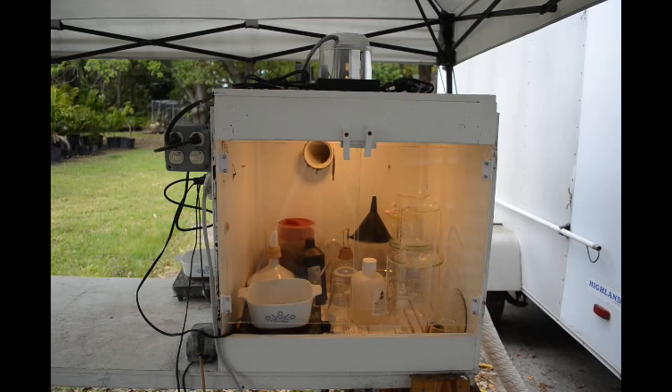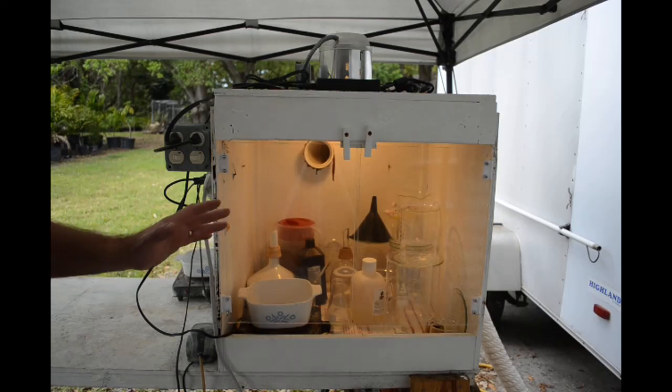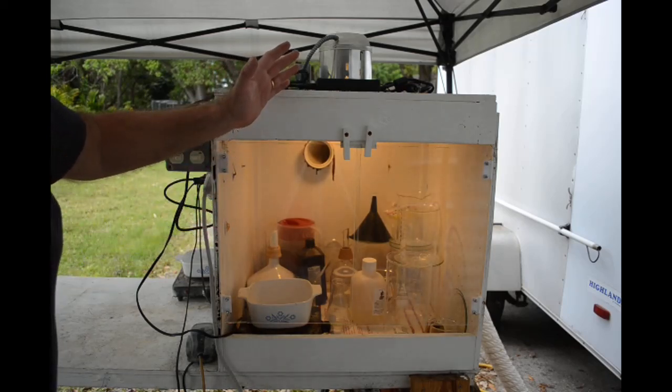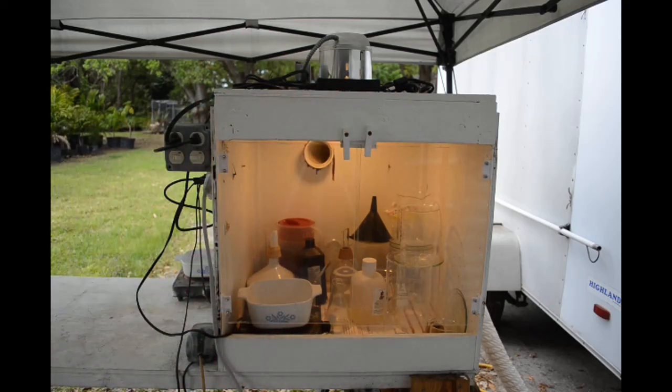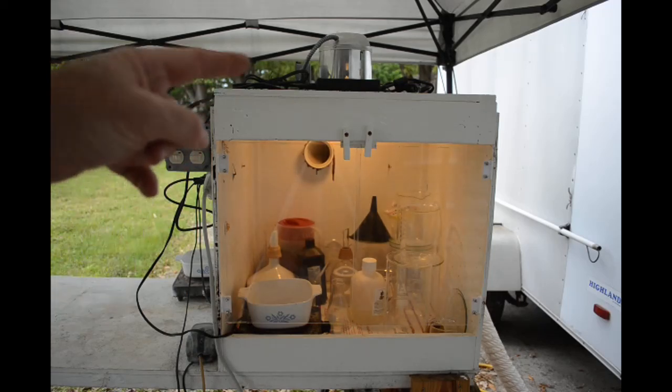That did not work. That fan was totally destroyed in very short order by the fumes coming off the chemicals I was working with. And worse yet, while it was in the process of destruction, nasty rust-filled condensate would drip down all over the inside of the fume hood over whatever I was trying to work with.